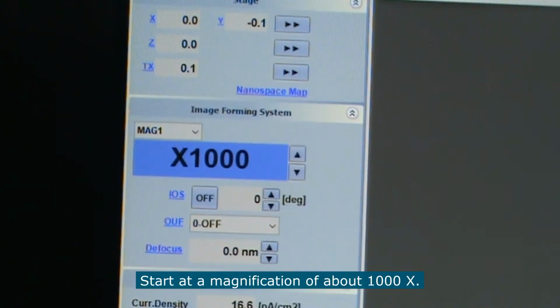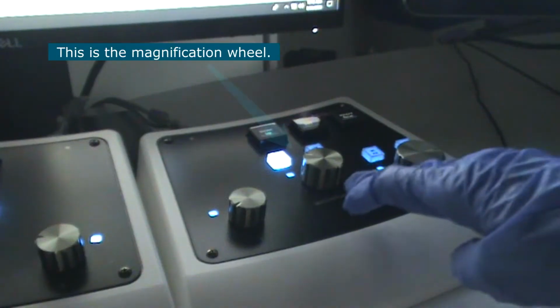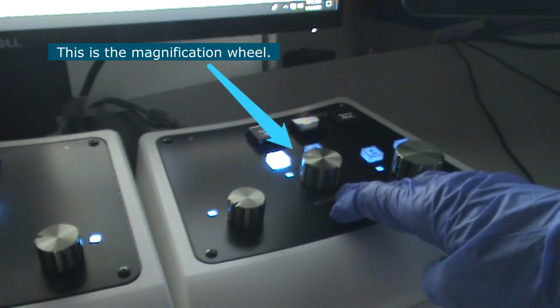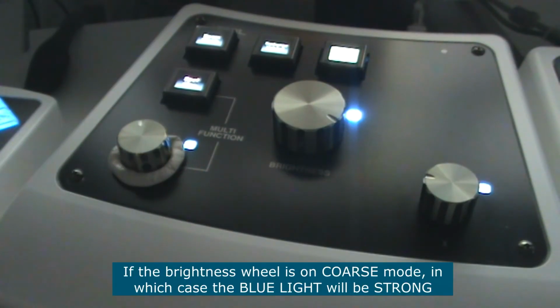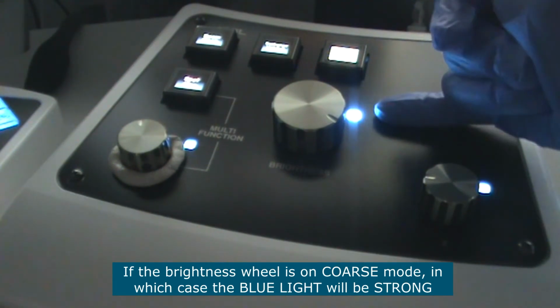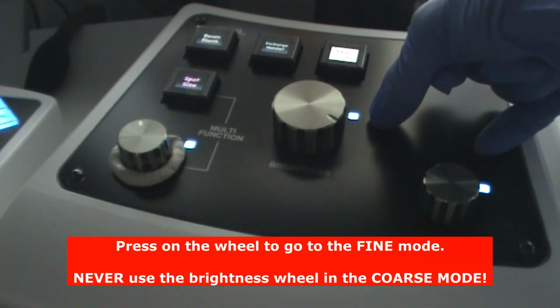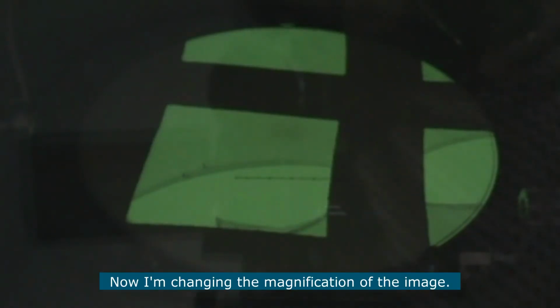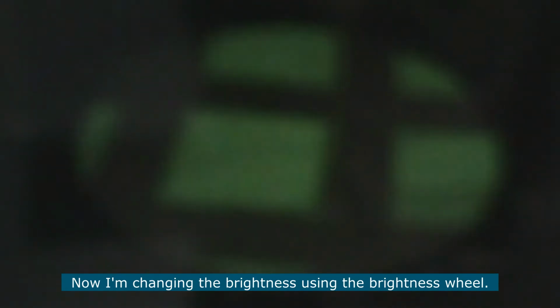Start at a magnification of about 1000 and use the brightness button to spread the beam. Here's the magnification button. Here is the brightness button that you use to spread the beam. If the brightness wheel is on coarse mode, in which case the blue light will be strong, then press on the wheel to go to the fine mode. Now I'm going to change the magnification of the image. And now I am changing the brightness using the brightness button.